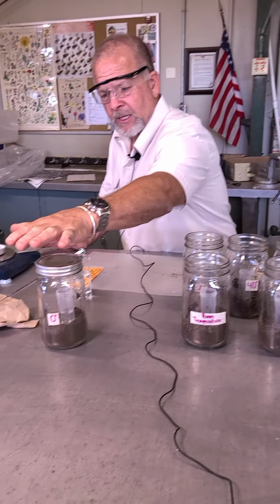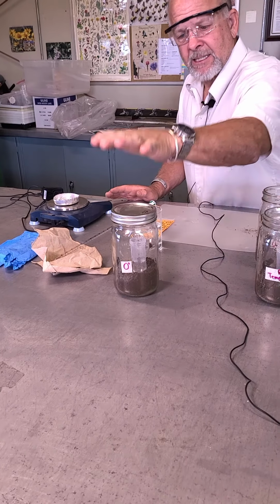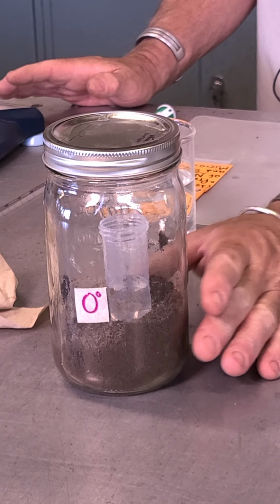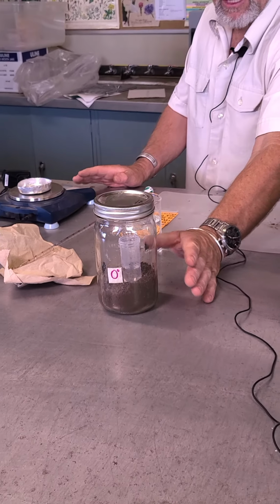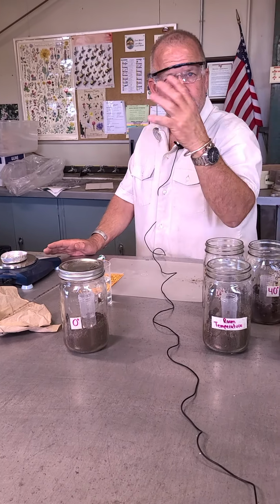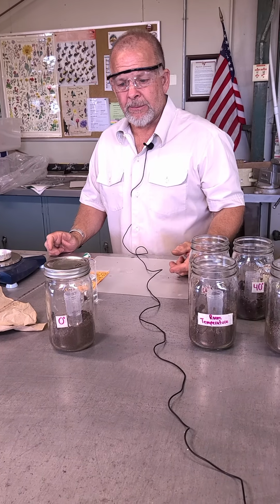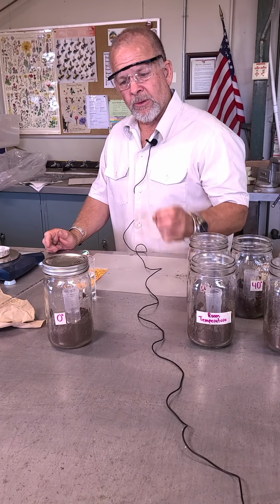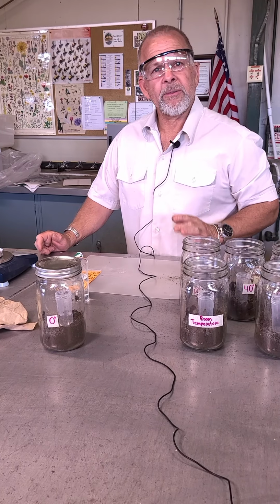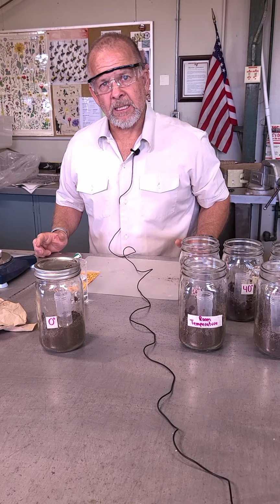Remember, now we've got the sodium hydroxide inside that little centrifuge tube that is going to act as a carbon dioxide trap. These little microbes, microorganisms, should be starting to do their stuff. We've given them moisture in that dry soil. They've got adequate moisture, they've got food stocks available. They should be beginning to multiply their colonies, building up, getting excited about the nice conditions, and begin to produce carbon dioxide. And we'll see if putting them in different temperatures is going to make a difference in how much carbon dioxide they actually produce.